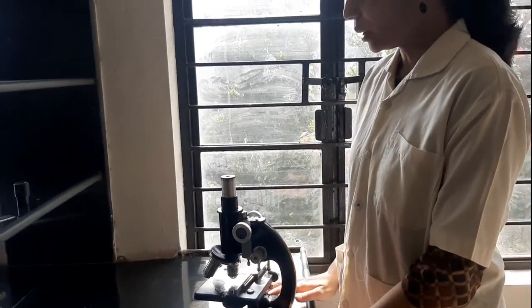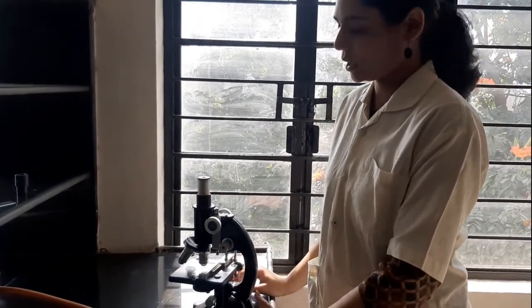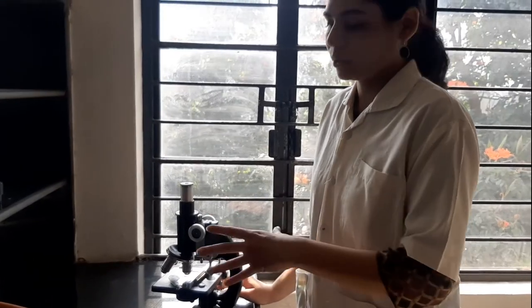Okay, so now it has been adjusted. Now we will see how it is visualized.